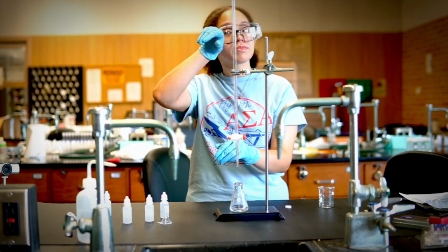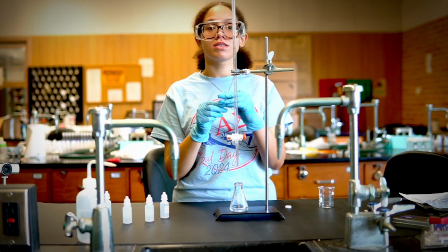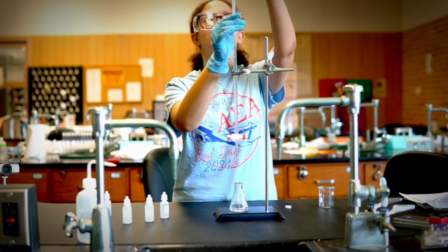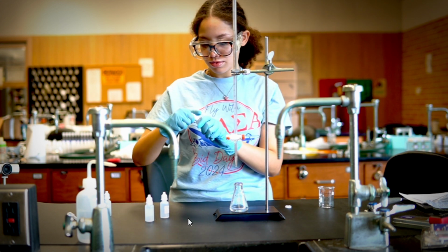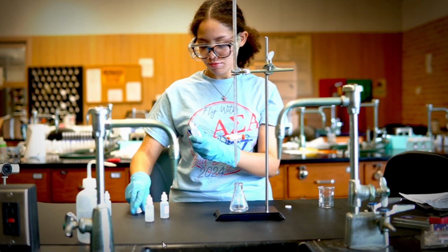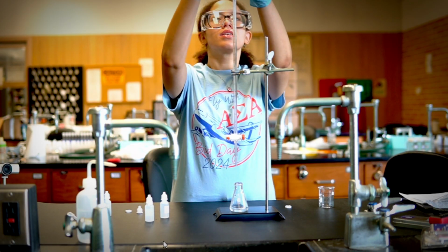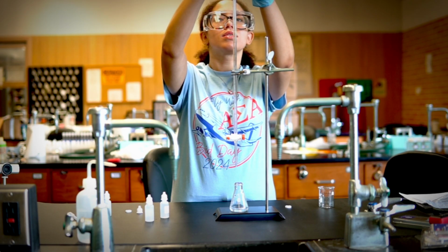So to pour the NaOH into the burette, first you gotta make sure that it's clean. You gotta make sure that it is closed. It's in the closed position, which is horizontal. And then you're going to add a funnel on top. You should have a tiny funnel in your kit. If not, that's okay, because we are going to use those little dropper bottles that should fit right in there.